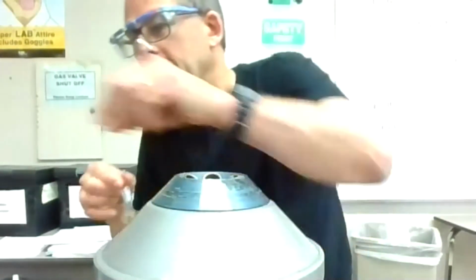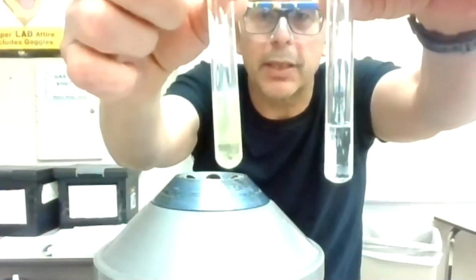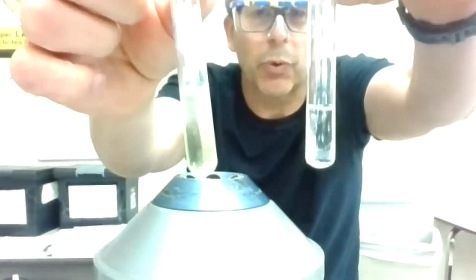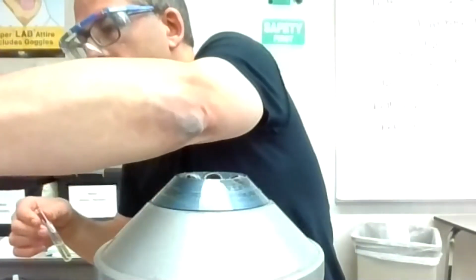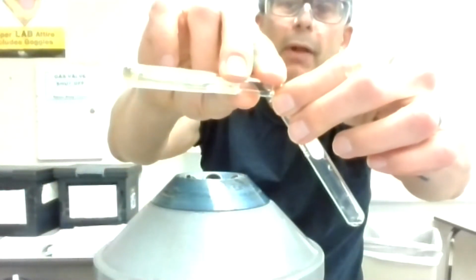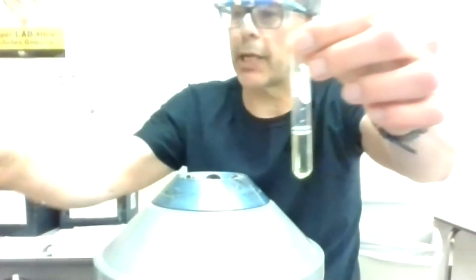Okay, now I'm going to put that in a different test tube and compare it to another test tube. I think you can see that haziness looks a little different. This is the one with strontium that probably looks more hazy than the one that's just distilled water. It'll be interesting to see what you're seeing in the video when I look at that again. Okay, so I'm going to skim this off so I don't have that frosting on the glass anymore. And yeah, I can see there's that residue left on that frosted glass for strontium, and that is what we'll call a positive test for strontium.